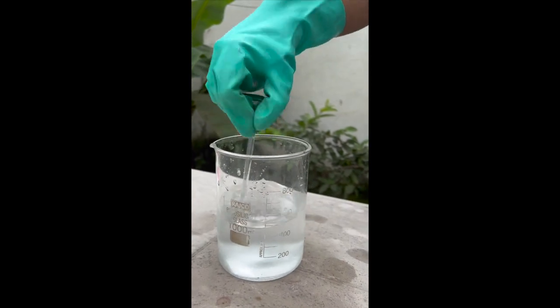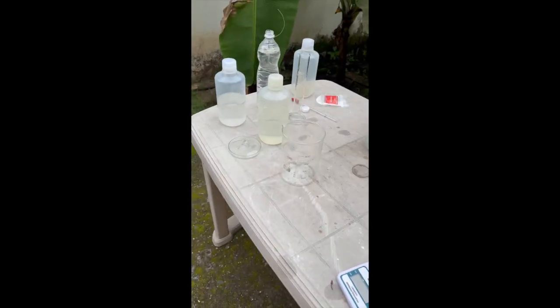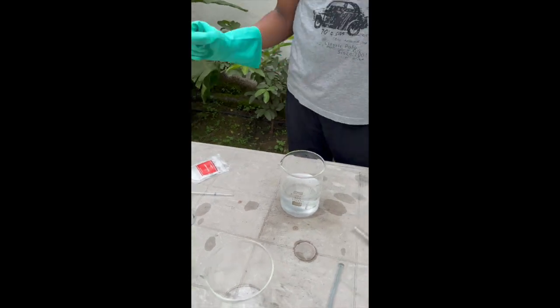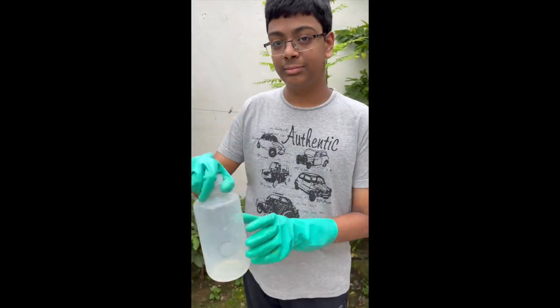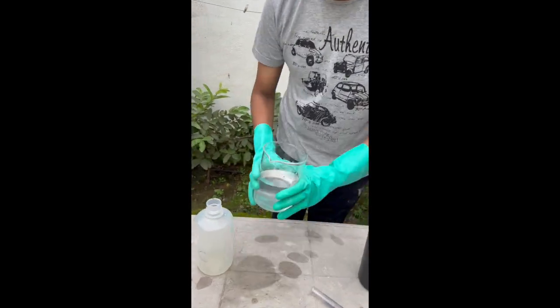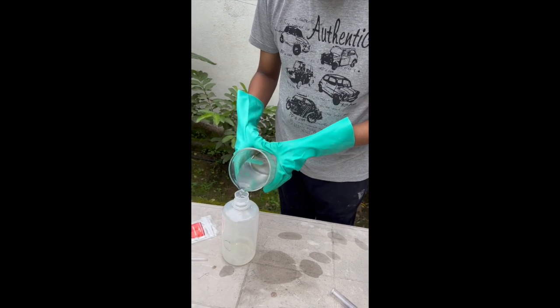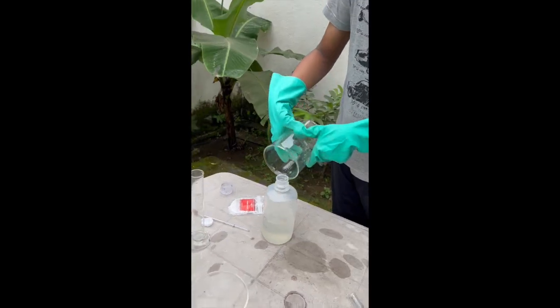It took an extremely long time to mix this properly but I was finally done and it is time to pack this in and time for the fun part now. So, let me add this to the container C and let's move on.